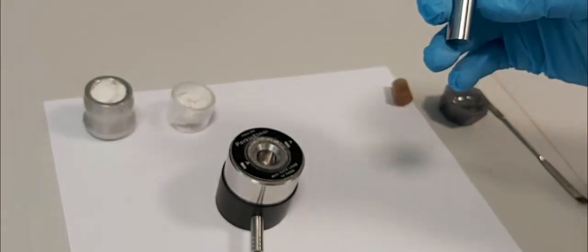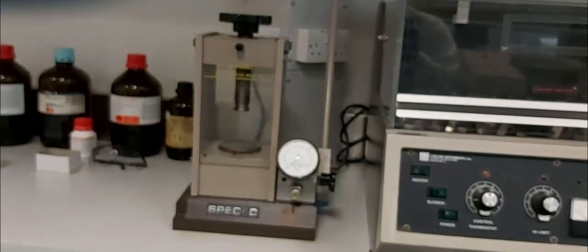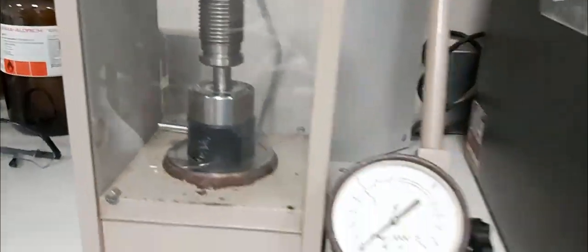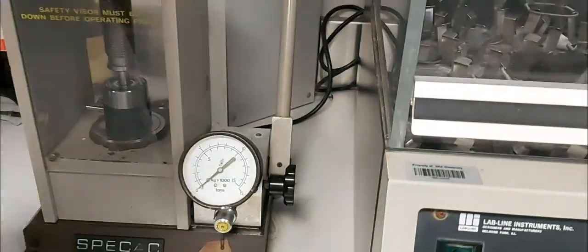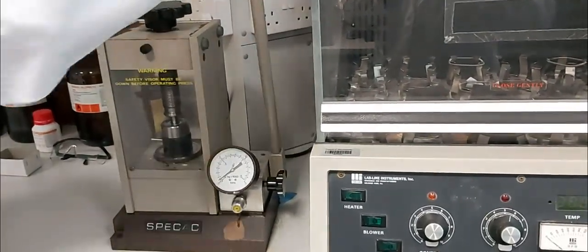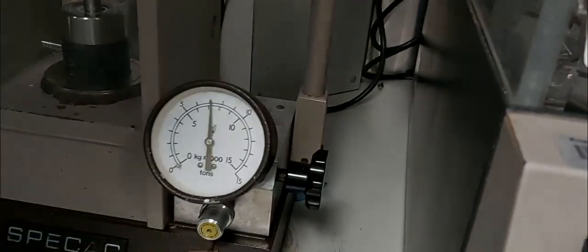Then we place the sample die in the hydraulic press, as you can see. We close it up very well, then we apply pressure up to around 10 tons, as you can see on the manometer.